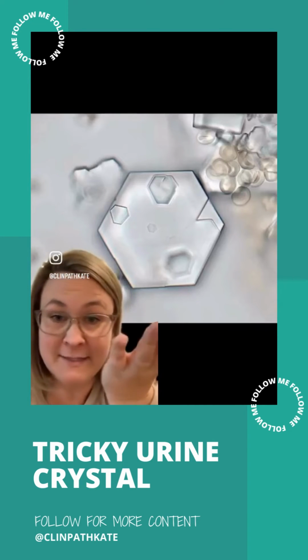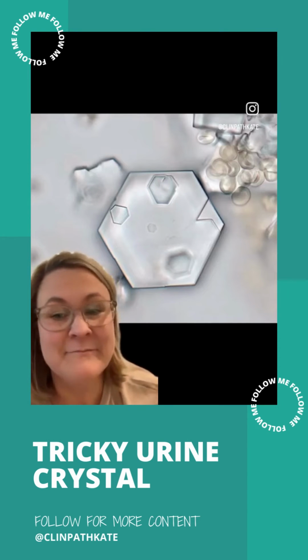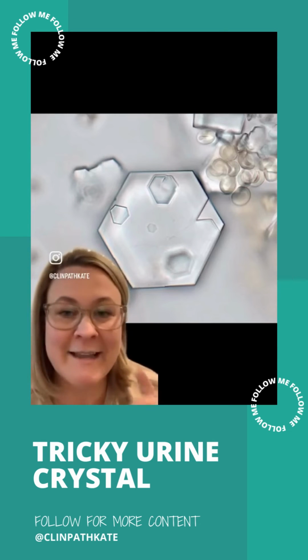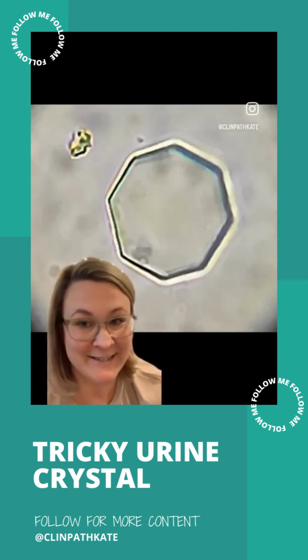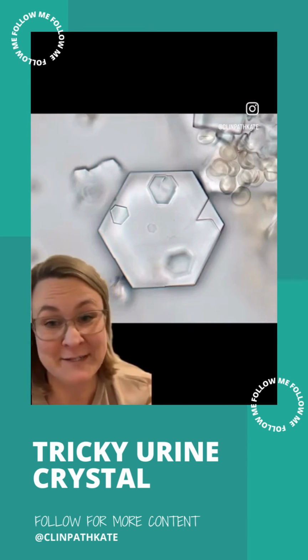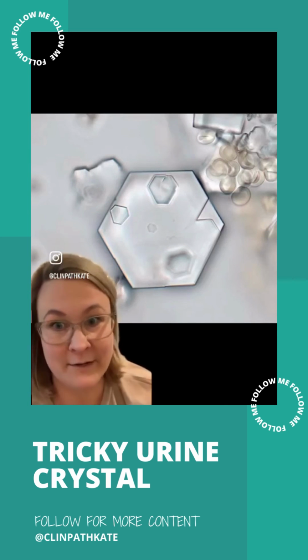Here's a beautiful cystine crystal, one of my absolute favorites. How many sides does it have? It has 6. Cystines are hexagons. They have 6 sides. They do not have 8 sides. So even though at first glance they look very similar, the one we saw before has 8 sides, not 6. So it is a struvite, not a cystine, which is a very important distinction because the significance of these two crystals varies significantly.